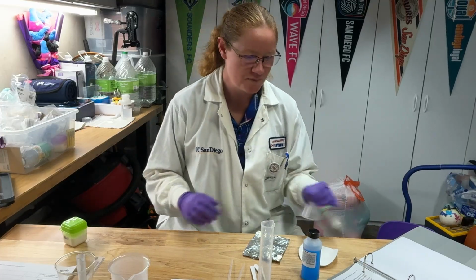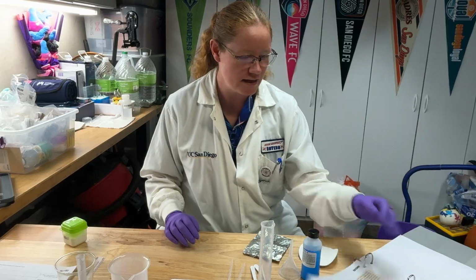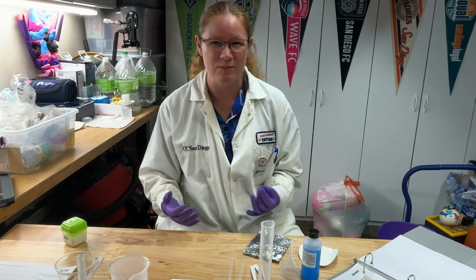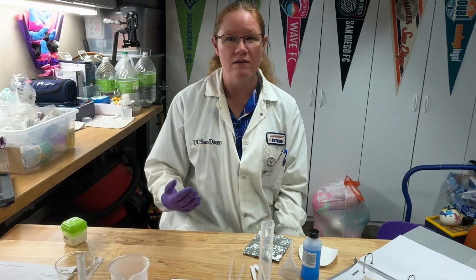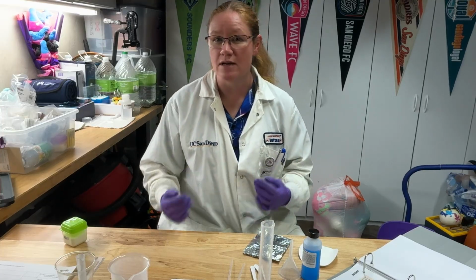All right, so the reaction itself is fairly straightforward, but we want to make sure that we are actually getting some good numbers, because this is going to be a quantitative experiment, not just a qualitative experiment. In a qualitative experiment, we're just caring that things happen and we take observations down. In a quantitative experiment, not only do we take observations down as to what's happening, but we also want numbers. Because remember, one of our goals later is to figure out not just the theoretical yield, but the percent yield. So we have to have good numbers, all right?